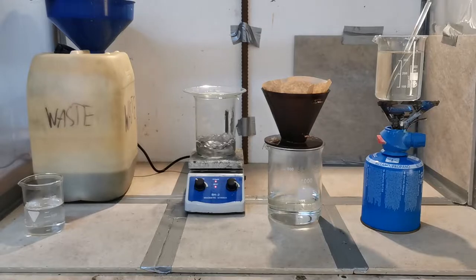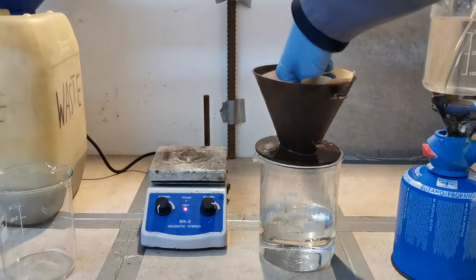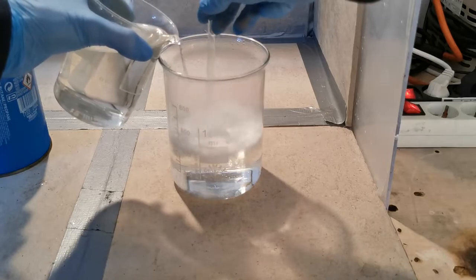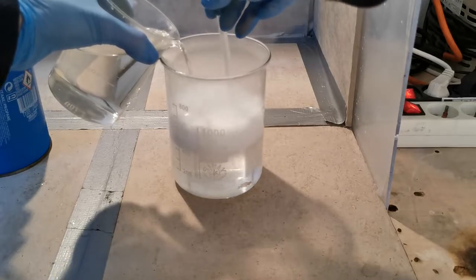Once all of the metal was gone, I decided to quickly filter the solution through a coffee filter to get rid of any undissolved residues. Afterwards, I started to neutralize it with the solution of sodium carbonate. Make sure to use a large enough beaker, especially if you used such an excess of HCl like I did.